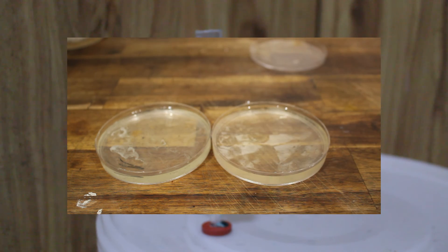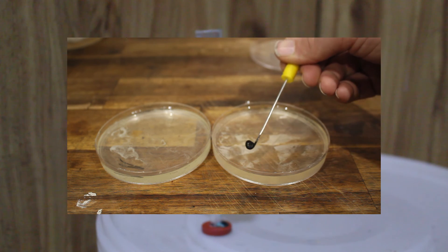Second, keep the plates upside down. This avoids the condensation, contaminating your yeast and possibly leading to food poisoning. Third, select only known good colonies. When in doubt, do not propagate.